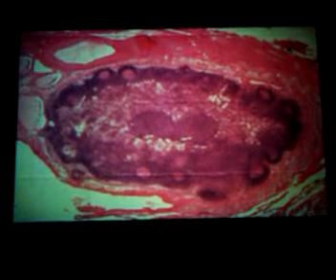Whole lymph node here, basically you can see the center of these for the most part. You can see the cortex and you can see the medulla fairly easily. You have your connective tissue here. There's going to be some loose areolar tissue and some dense irregular tissue. There's going to be some fat over in here. This is the muscular artery going all the way through here. The wall here, if you look at that, you would find the smooth muscle cells.